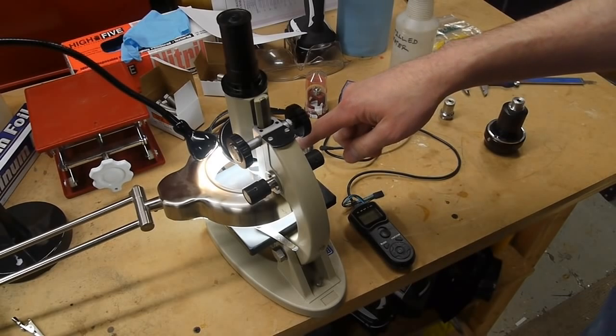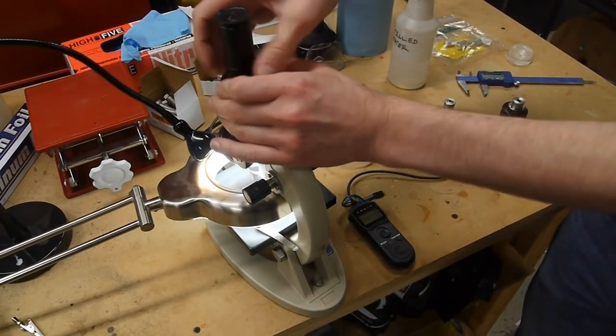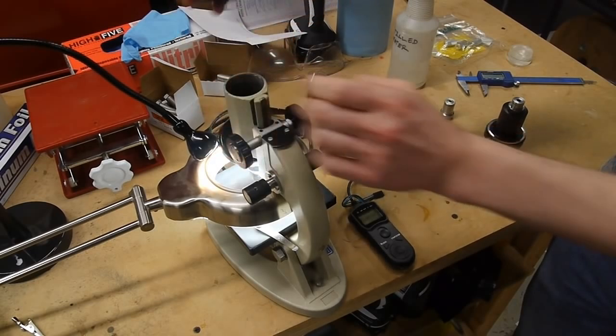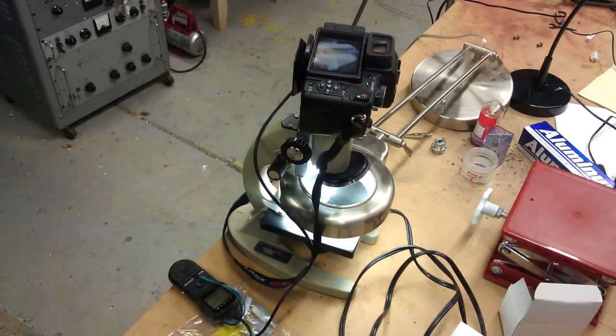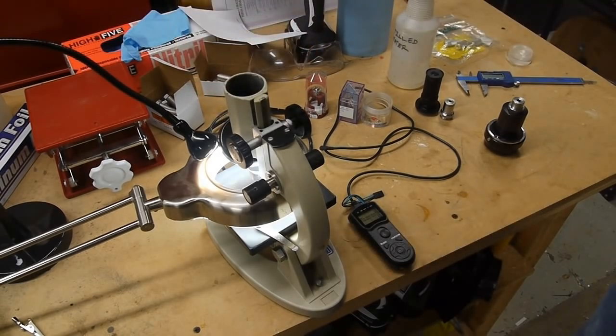So what I do on my microscope is just unscrew the eyepiece, because we don't need the eyepiece to make an image on the focal plane. So what's happening here is the microscope objective is already forming a real image up here. So if we just put the camera right here, then everything works and we can control the zoom level, or control the magnification level, just by sort of fine-tuning the position of the camera.